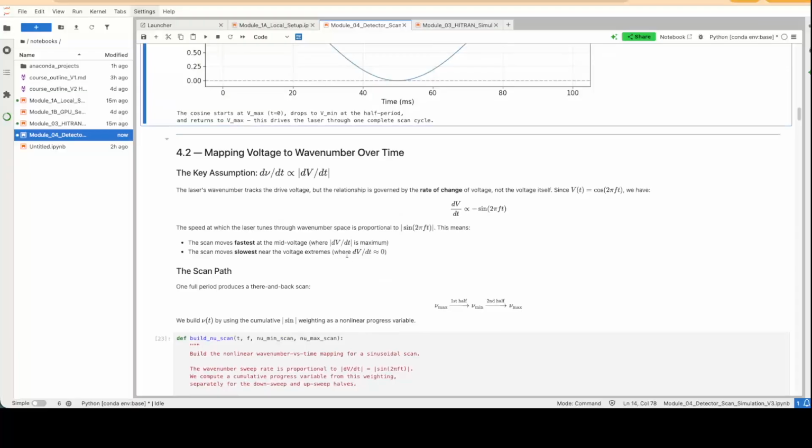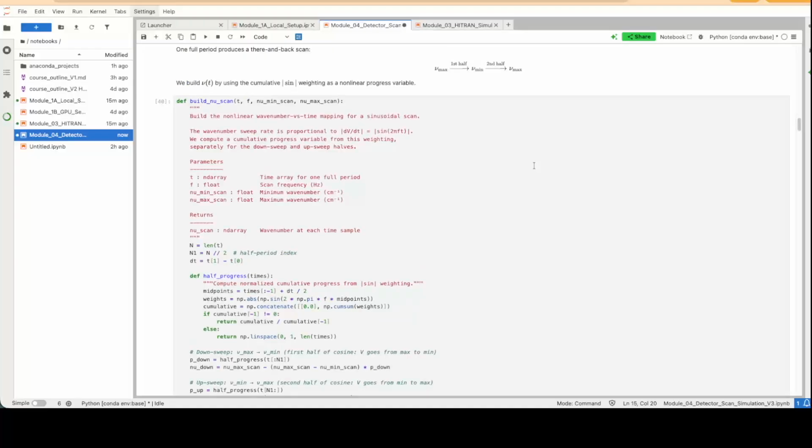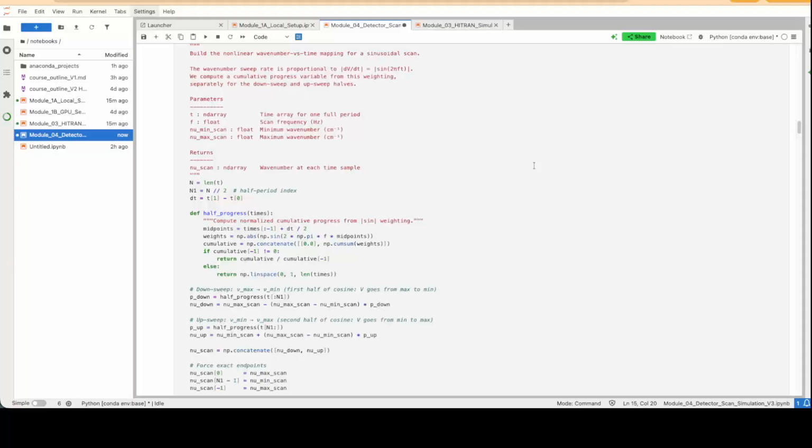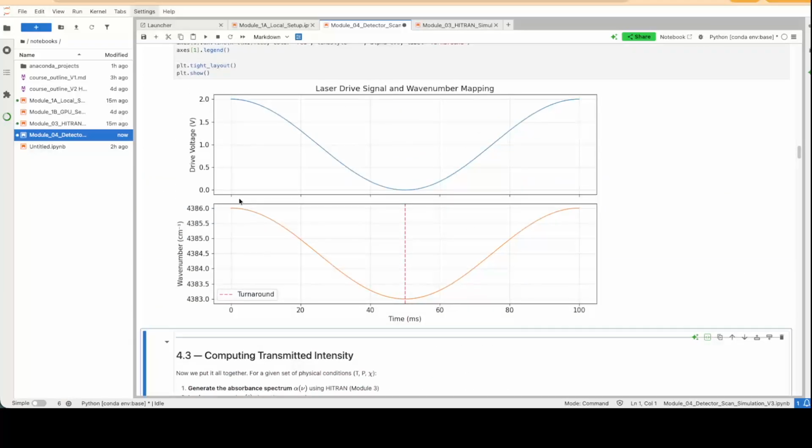If you start moving into the kilohertz, tens of kilohertz range, then the thing to do would be to actually measure that response instead of trying to guess at how the output wavelength changes with your drive current. You can measure it using an etalon, and you wouldn't have to make any assumptions. You'd have a direct measure of how the output wavelength changes with time. This is just a general way of doing this since we're simulating it. This part maps wavelength to time, so then we can plot the output. Depending on the drive voltage, you're going to see a similar change in wavelength, in wave number.